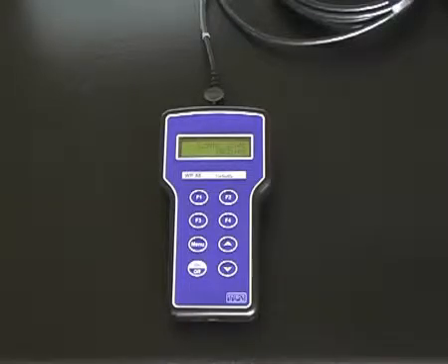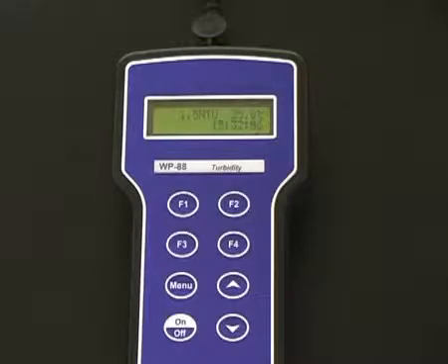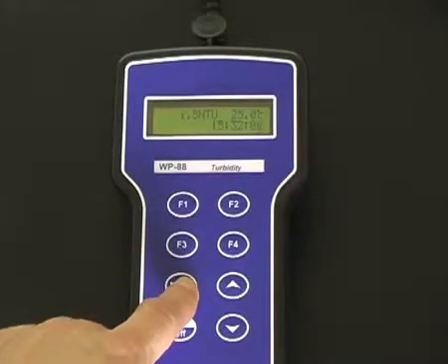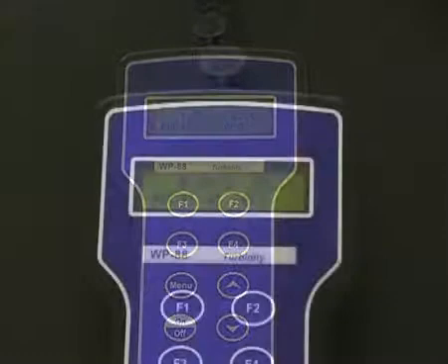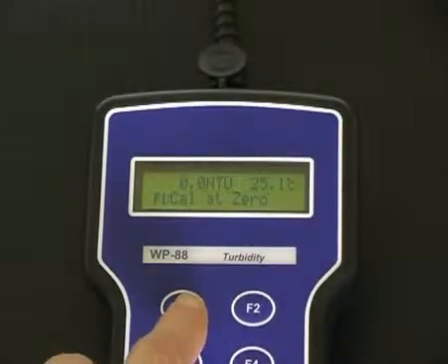Press menu first, then F1 to calibrate. Press F1 to accept the calibration instead of enter.